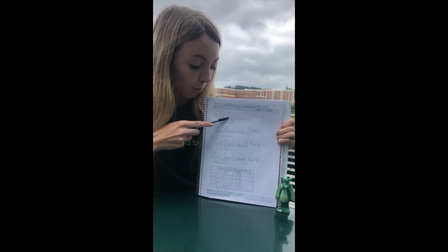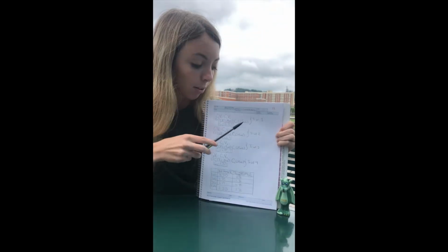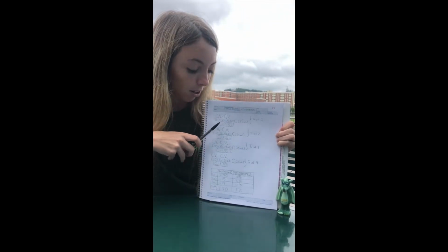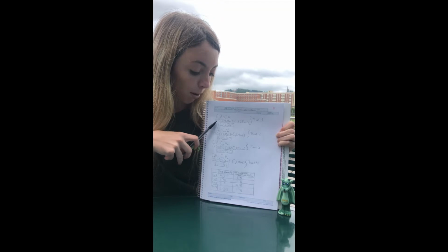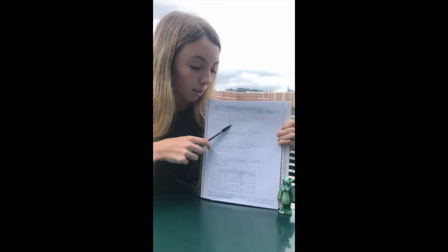Then we added water to the stock solution in the volumetric flask until the volumetric flask was filled up to 25 milliliters. That will be our volume 2 of the dilution. Now we can measure the concentration of the dilution just by plugging these numbers into the equation. And we got our concentration out to be 3.76% of sugar in the new dilution.